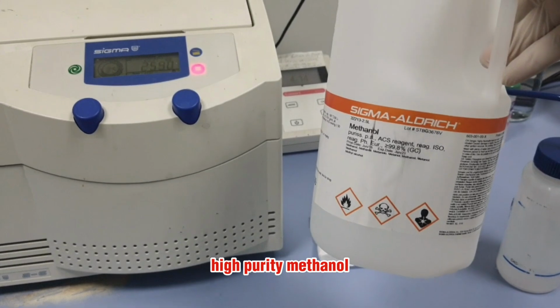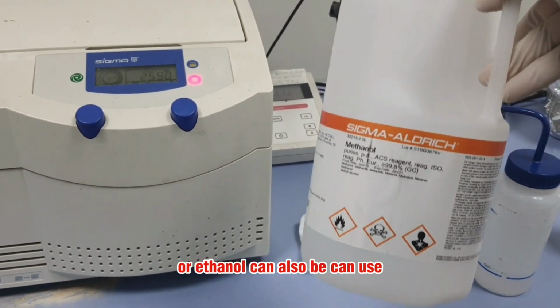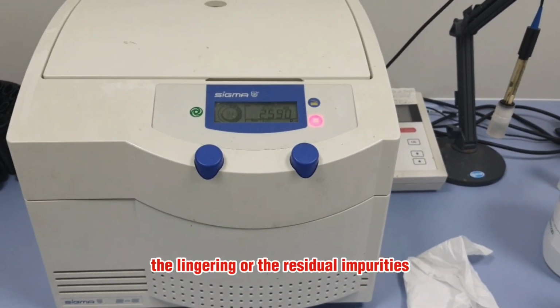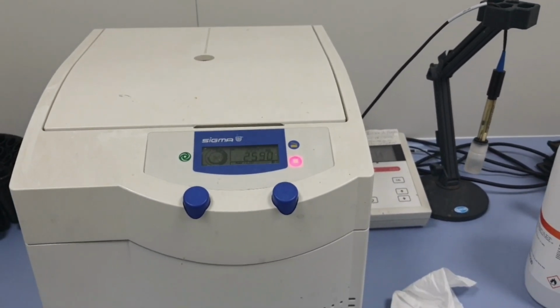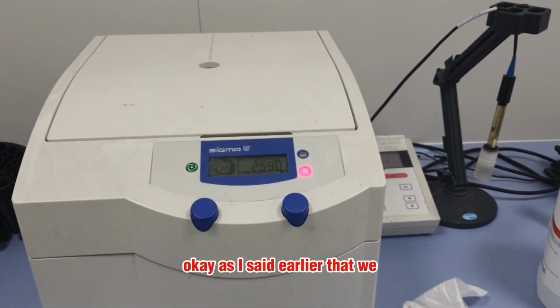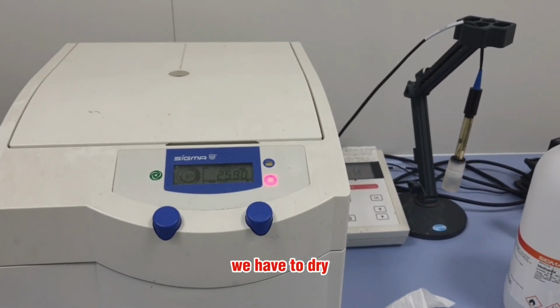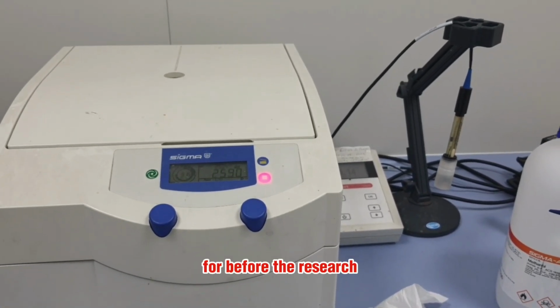methanol, high purity methanol. We can use methanol, acetone, or ethanol, in order to remove the lingering or residual impurities from the prepared biochar LDH. As I said earlier, after the whole washing with water and acetone or methanol, we have to dry it, and then we can store it after crushing for further usage.